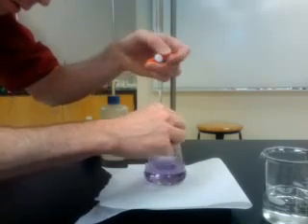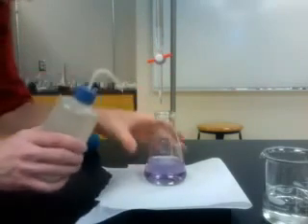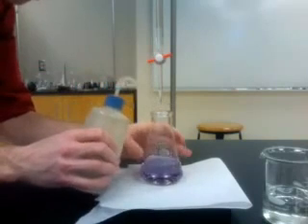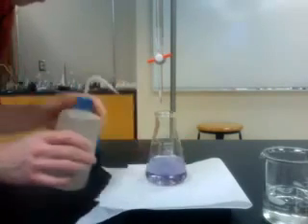The ideal endpoint for this titration is a color that has no red traces to it, a crisp blue. As you can see here, we've now reached a blue color without any traces of red or purple.